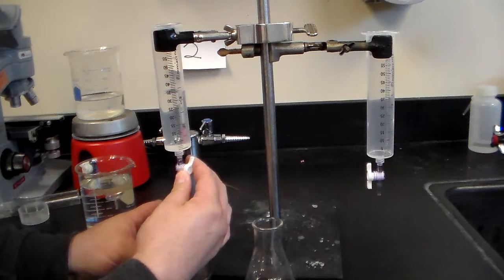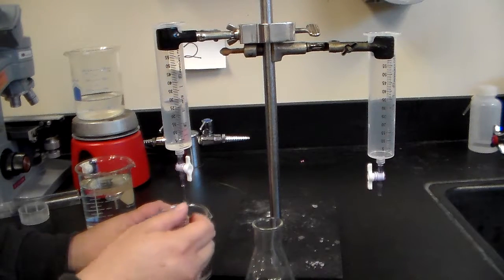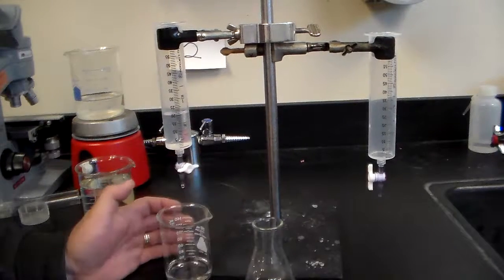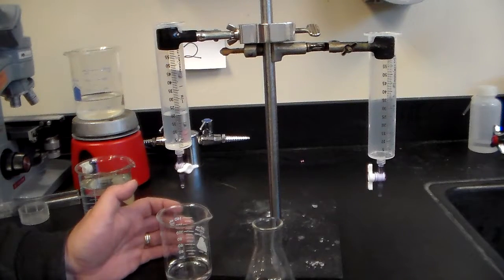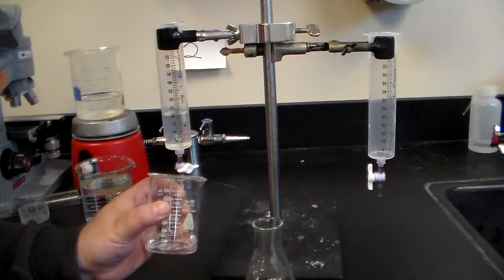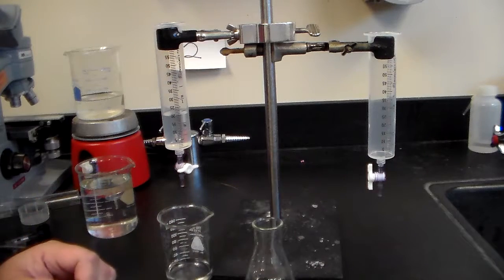To do that, we're going to turn the valve, the white valve, open like this. You'll notice how it's freely flowing. I'm just showing you how you can do that. Then you can close it like this. Now you have a little drop there, so you can just tip the side of the beaker to pick up the drop from the spout of your burette.